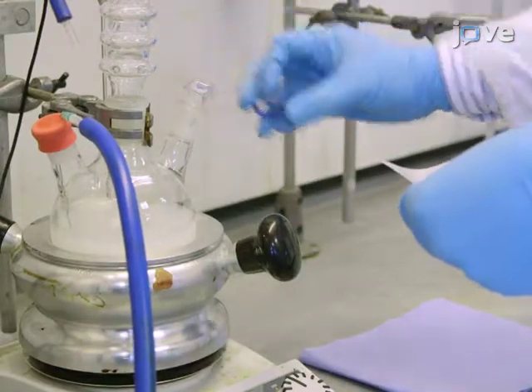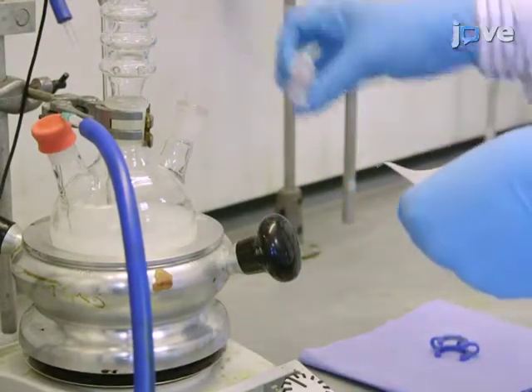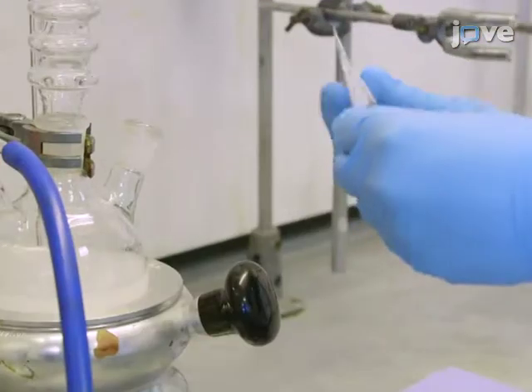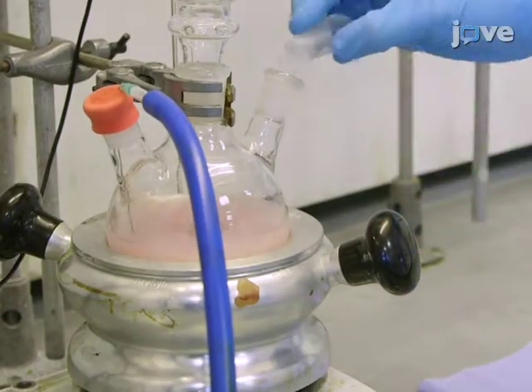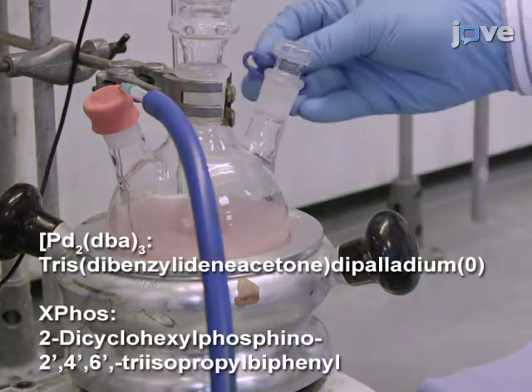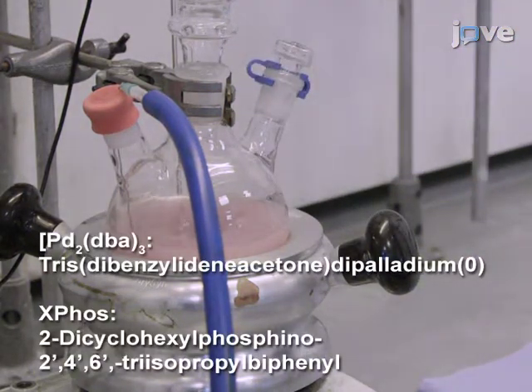Add 0.025 grams of palladium DBA and 0.06 grams of XPhos and degas the mixture for another 15 minutes while stirring. The most critical step of the procedure is the addition of the palladium catalyst and XPhos followed by degassing for 15 minutes. This must be done quickly to avoid degradation of the chemicals in air by oxidation.